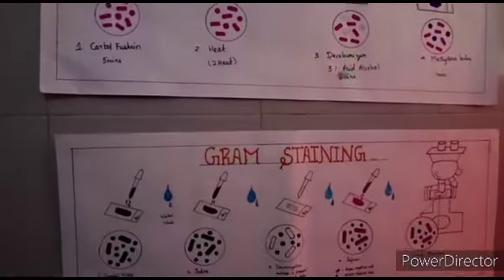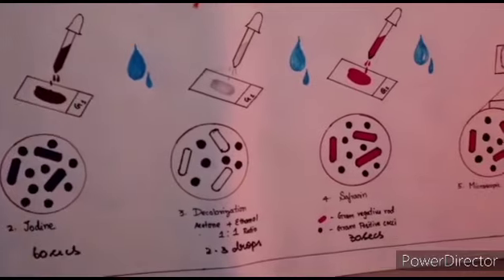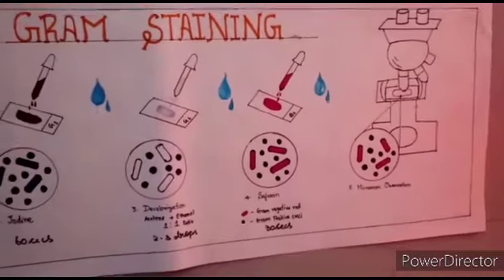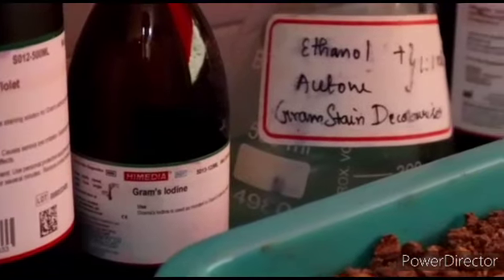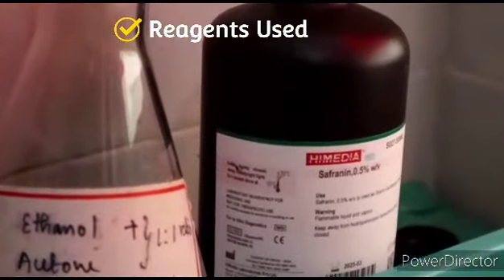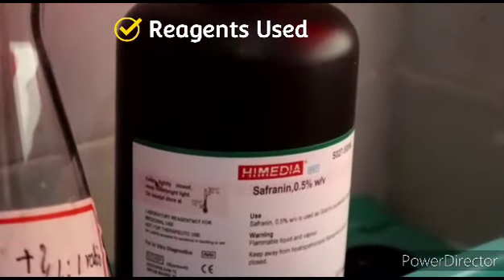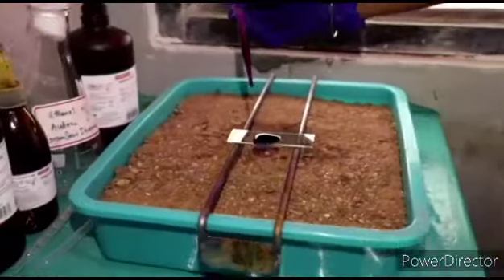The primary and most important diagnostic method is Gram stain, which is used to start primary antibiotics for the patient. For Gram stain, the reagents used are crystal violet, iodine, decolorizer that contains ethanol and acetone in a 1:1 ratio, and finally the counterstain safranin. The prepared heat-fixed smear was taken.